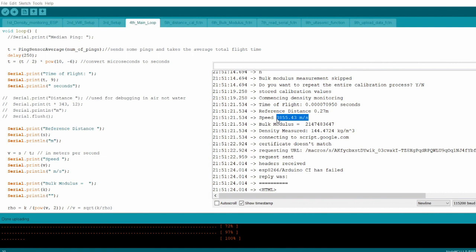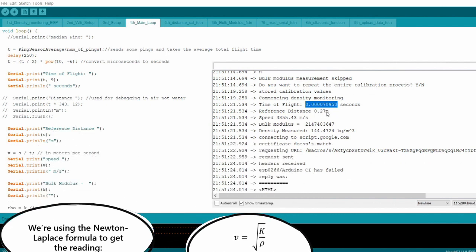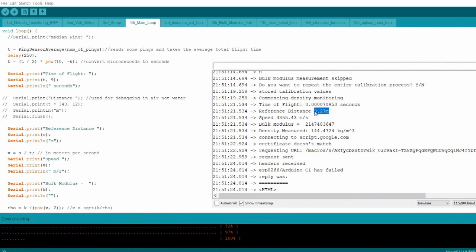So this equates to a speed of about 3,800 meters per second, which is very fast. It's about twice the speed of sound for a liquid. So I'm not sure if this is just because of the cider I use, and sound travels very fast in that, or if there's some other mistake. So it's about double, so there's a chance the time of flight or the reference distance is off by a factor of 2. It's likely not the reference distance because I measured that with the ruler as well to second guess it.